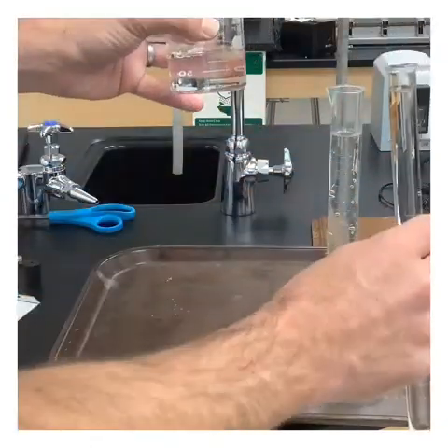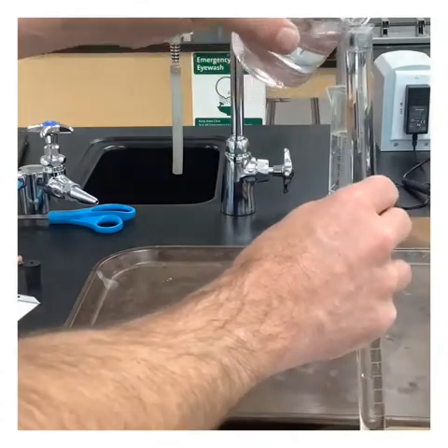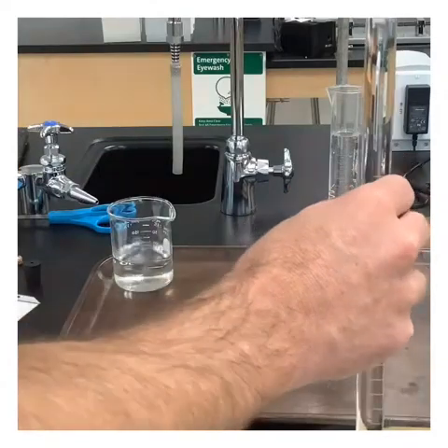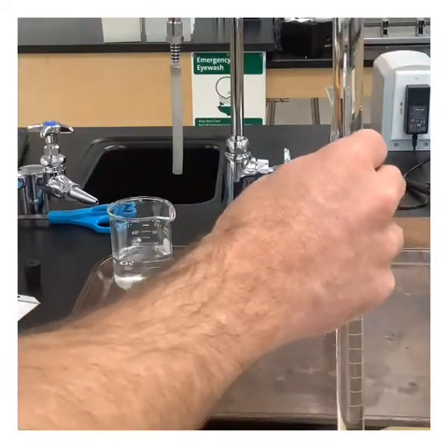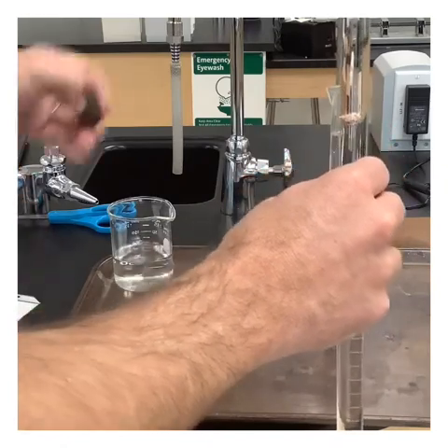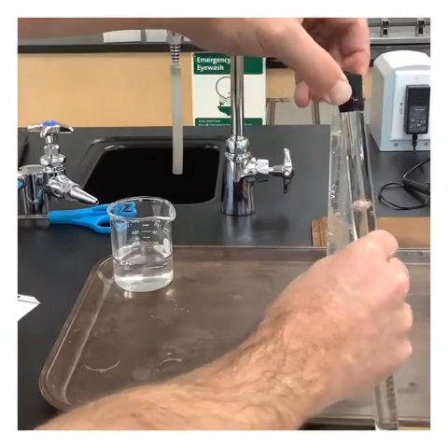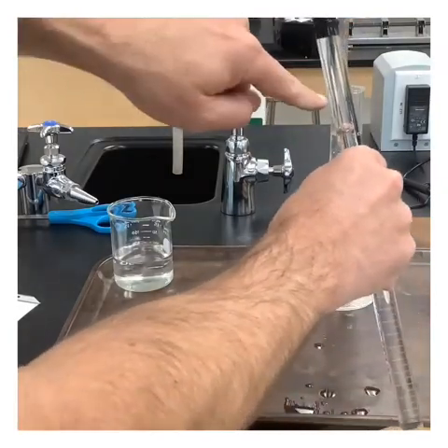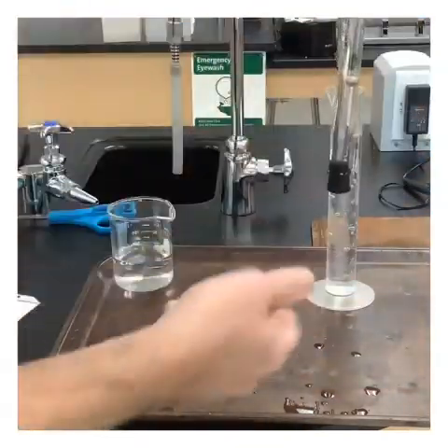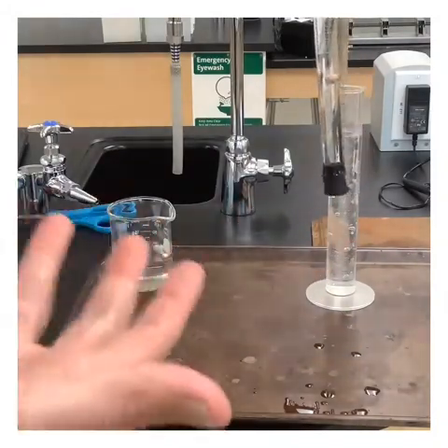All right, so we see at this point, we're about full. I'm going to get it all the way up here. That's close enough. I'm going to go ahead and put the magnesium into the tube. And then I can take my rubber stopper, and the rubber stopper will fit right on top. I'm starting to get some bubbling, so I've mixed a little, so I need to flip this. So I'm going to flip it. The bubbles start going up, and you'll notice that the water's not coming out right now because of the surface tension of water. It's able to hold it in.